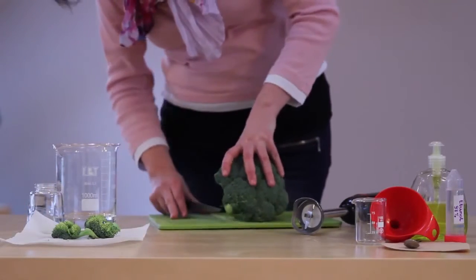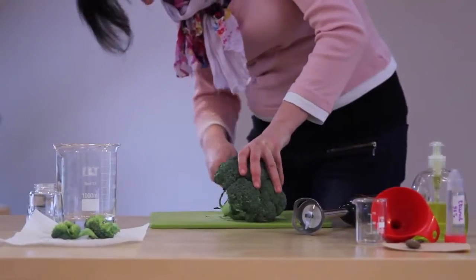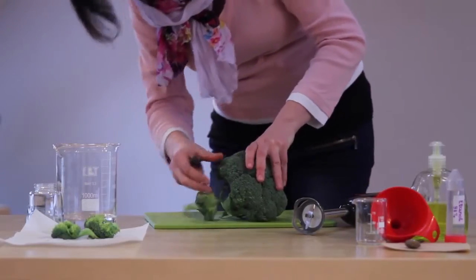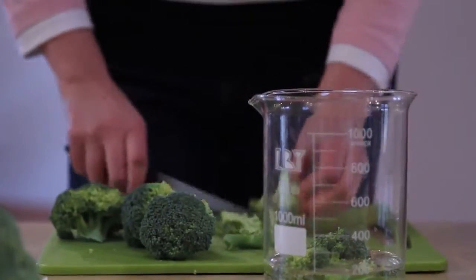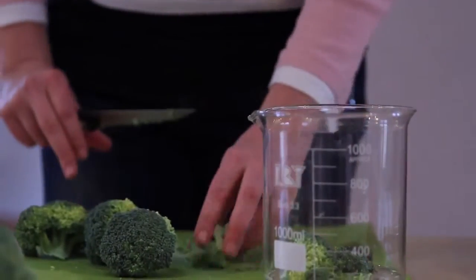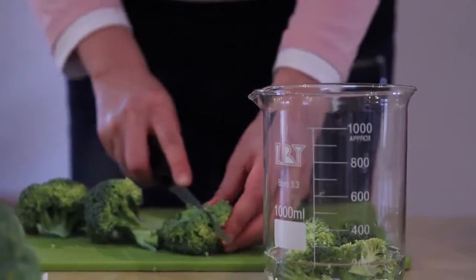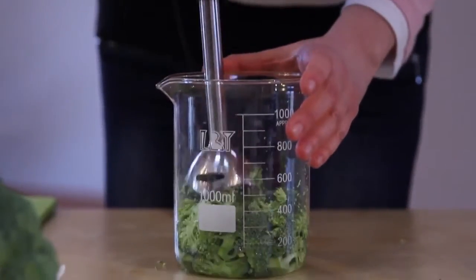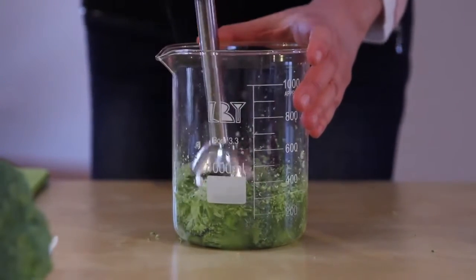The first step is to break down broccoli into little pieces. You can do this by hand or use a knife. It is important to get rid of the hard parts. It's very difficult to extract DNA from them. Only the broccoli flower heads go into the bigger container where you have some tap water. Then you complete the process using a blender.